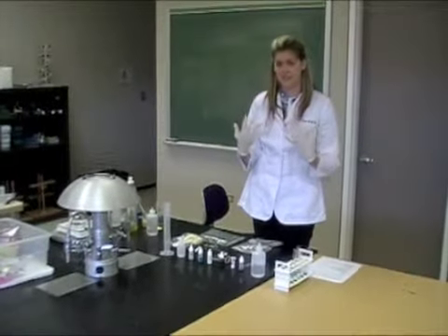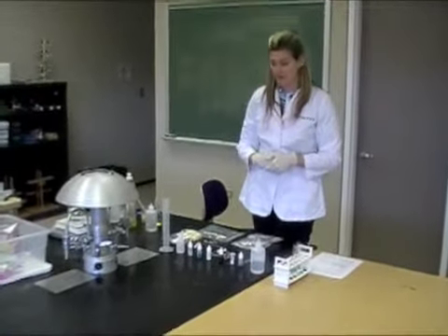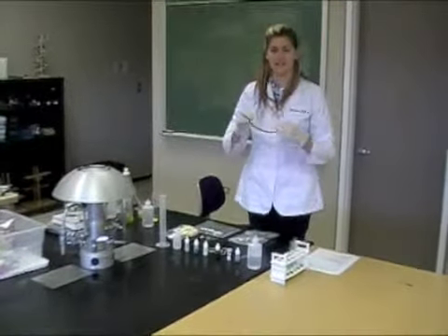So, first, gloves. The most important part, you have two pairs of gloves in your lab kit, and you also have a pair of safety glasses that you should put on while handling the chemicals.